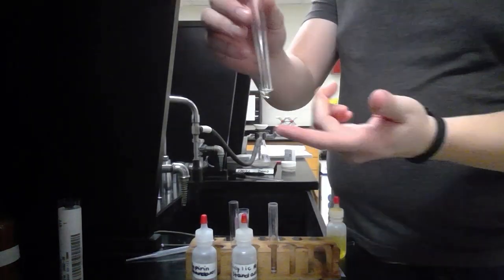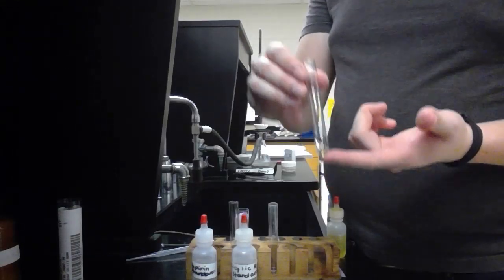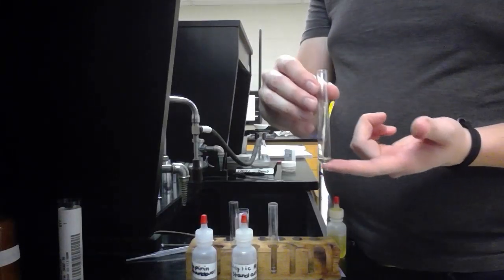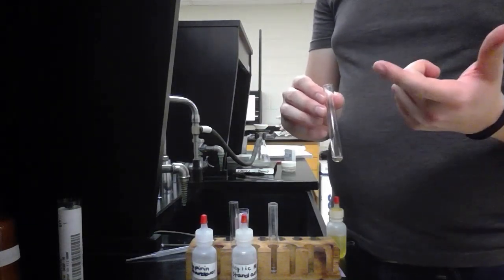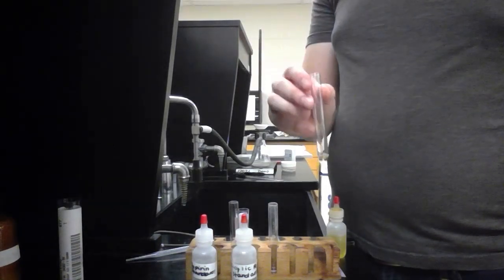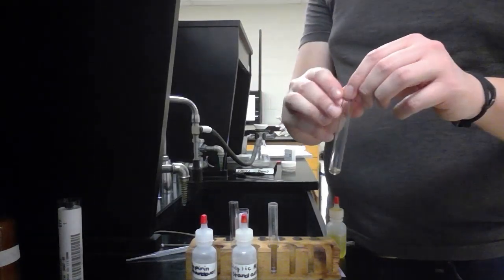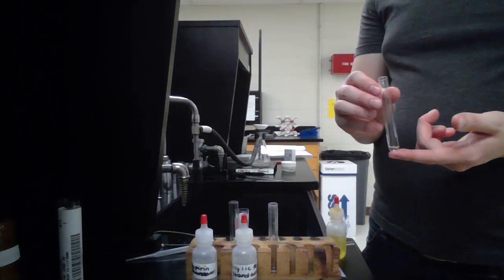The lack of a phenol but the positive result for the litmus paper test indicates that our final product was acidic, but it was not salicylic acid. That likely means that we have acetic acid contaminating the solution, which may be due to the fact that the solution may not have been rinsed completely enough.